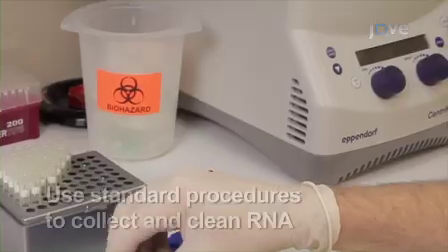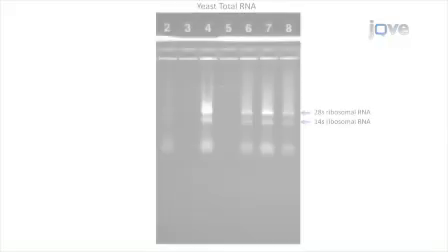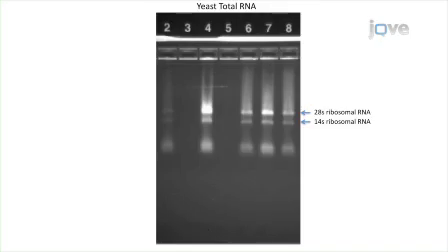After this, use RNeasy spin columns to collect and clean the RNA from the 2 cultures. Finally, evaluate the quality of the extracted RNA using a 1.2% precast agarose gel for electrophoresis.